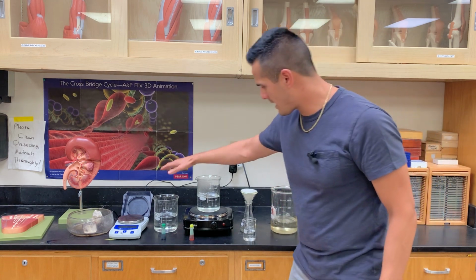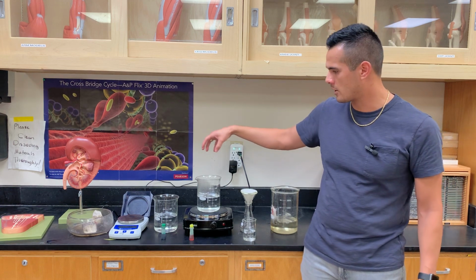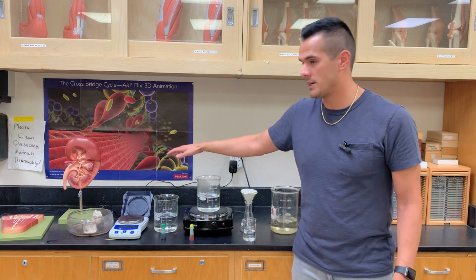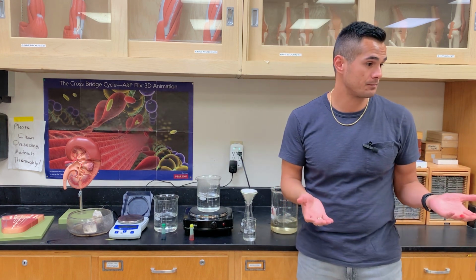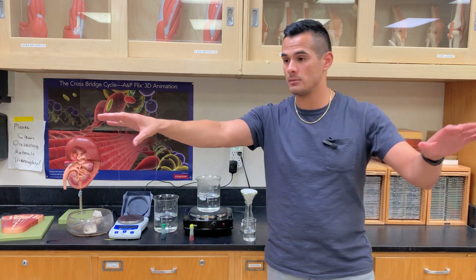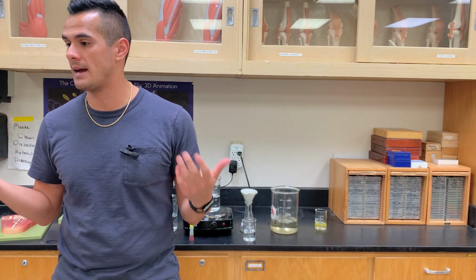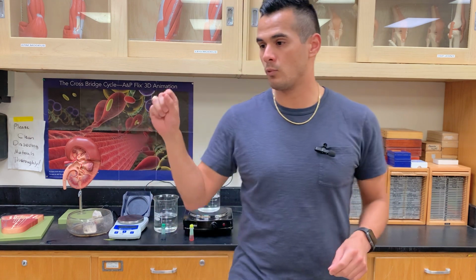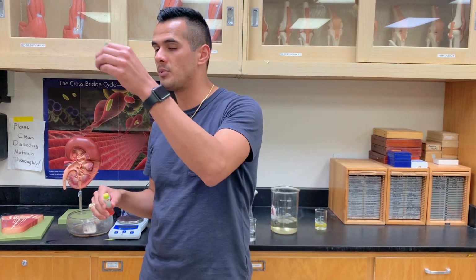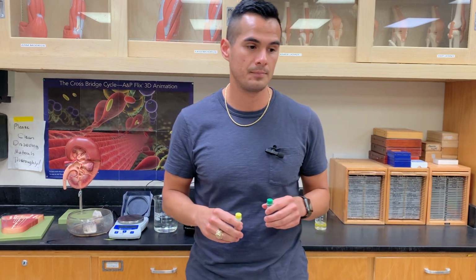Now what I have here is a hot beaker filled with water, and this is a cold beaker filled with water. What I'm demonstrating here is diffusion, but we're adding a heat source. This is why you have this experiment set up on your table. Let me explain what's going to happen. I want one person to get the red dye and one person to get the green dye, or whatever color it is that you have on your lab table. So go ahead and do that now.